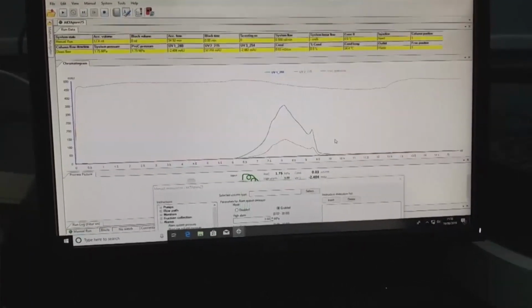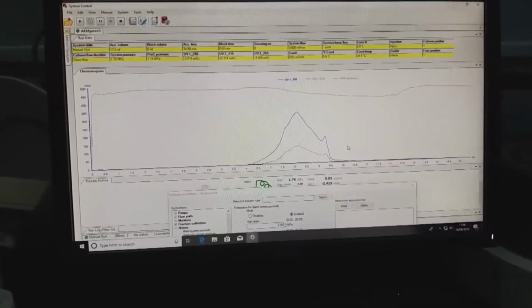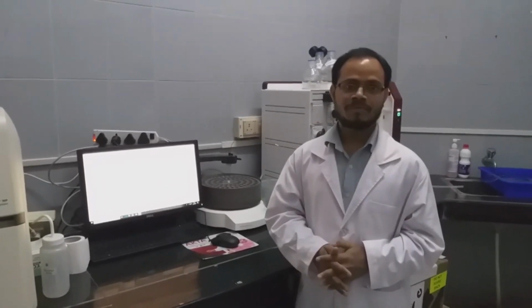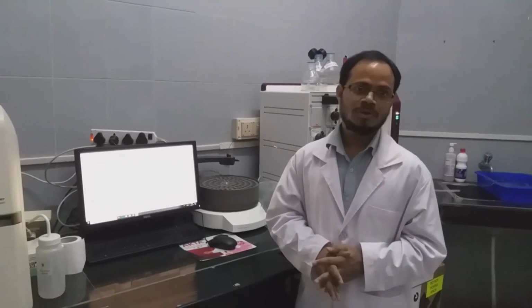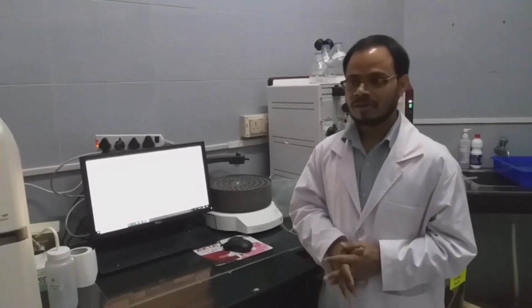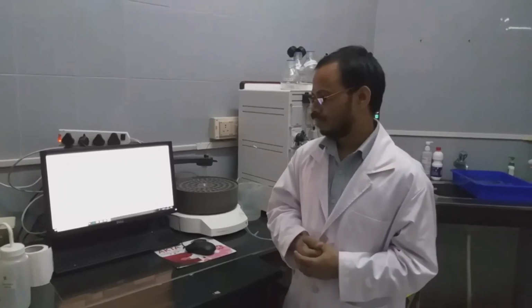So once this is finished, we have to run another column volume of buffer to remove any other proteins, and after that we will keep it in water to remove any kind of salts if present. Then we will keep it in 20% ethanol. We will run at least one column volume, so that we can directly use it to preserve the column. After that we have to purge the complete system with 20% ethanol, so that there is no contamination or bacterial growth if you leave it for a few days. So this is all about gel filtration chromatography. So we will show you how to analyze the result.